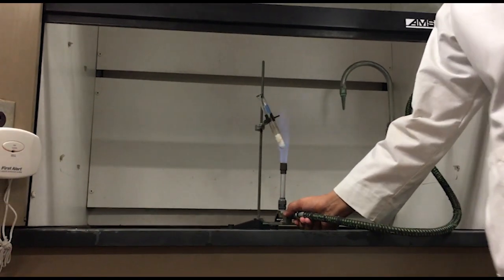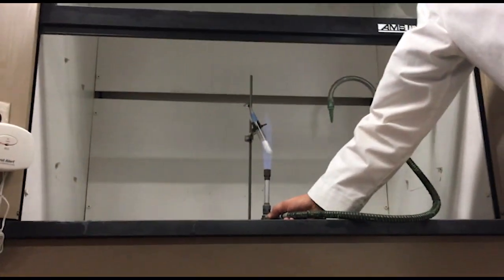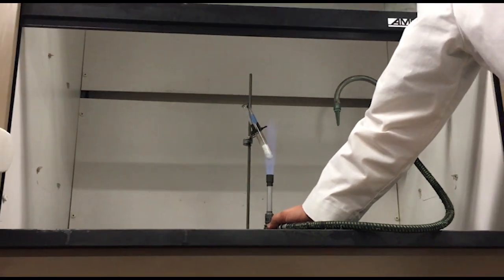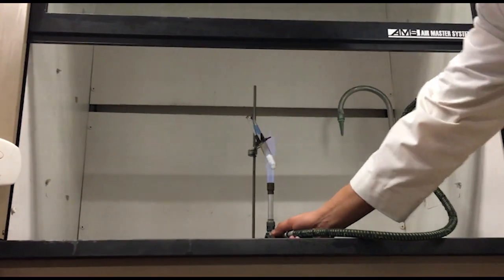This takes a few minutes here to decompose the sodium chlorate. So what I'm making there, you can see in the bottom of the test tube that it's starting to liquefy just a bit, isn't it? So what we're making is some molten sodium chloride. And that's what now? What's sodium chloride? Just salt? Yeah. Right? So I'm just making some molten salt in here.